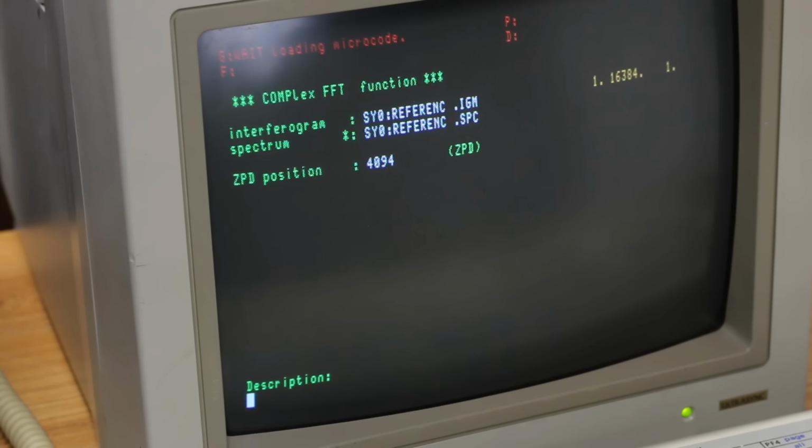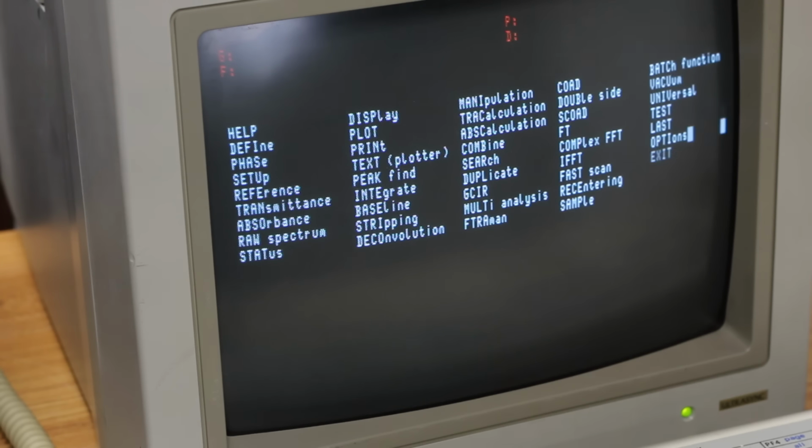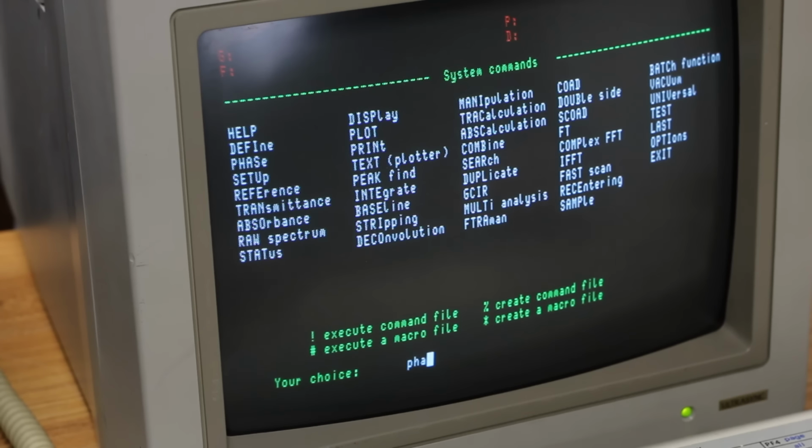So like it clearly is communicating with the vector processor, so it can load microcode. Actually, it's loading a boatload of microcode right now. There we go. Transferring data from host to VP, computing FFT, transferring data from VP to host. And yeah, there we go. All right, so that should definitively prove that we are able to communicate with the vector processor successfully. So let's try phase again.